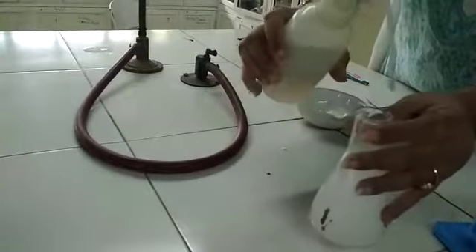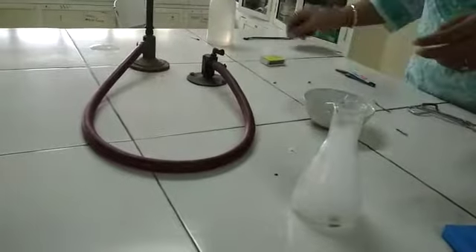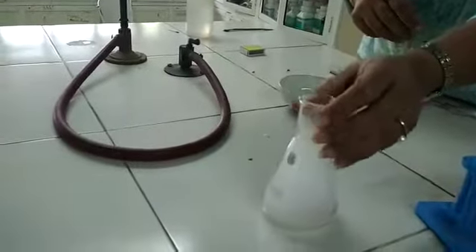Enough gas is collected. Sulfur dioxide is our non-metallic oxide. I dissolve it in water — it forms sulfurous acid. Now again to find its chemical nature, I put red litmus. You see the red litmus remains red. I put blue litmus, and the blue litmus turns red. This shows that sulfur dioxide is acidic in nature.